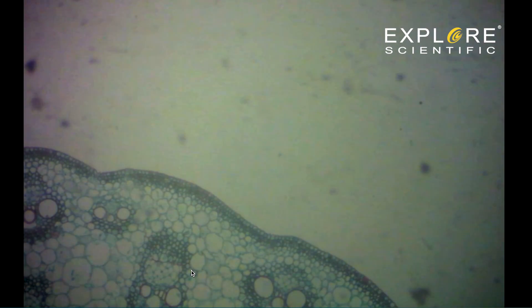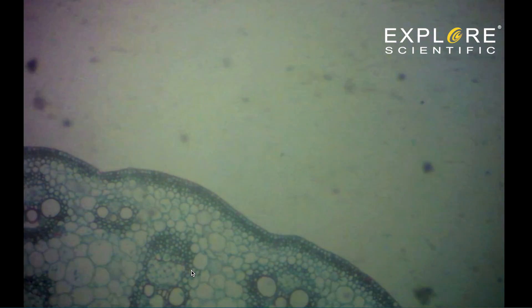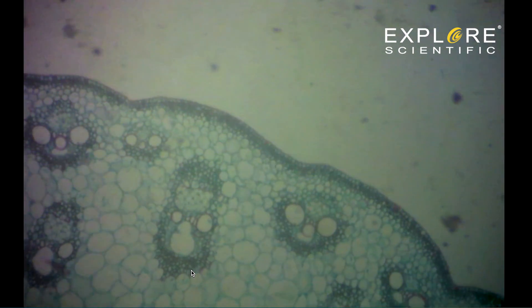Now, practice moving the specimen on the stage. It only takes very tiny movements to make a big difference in the eyepiece.